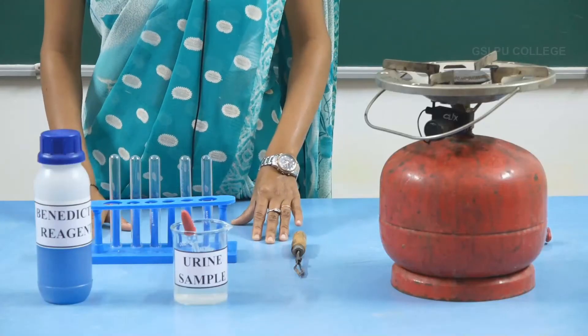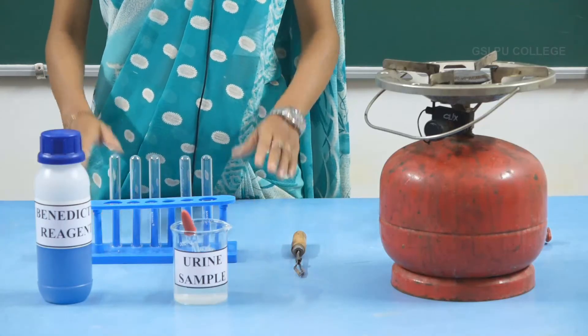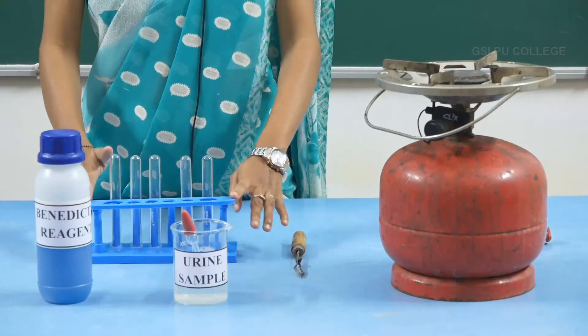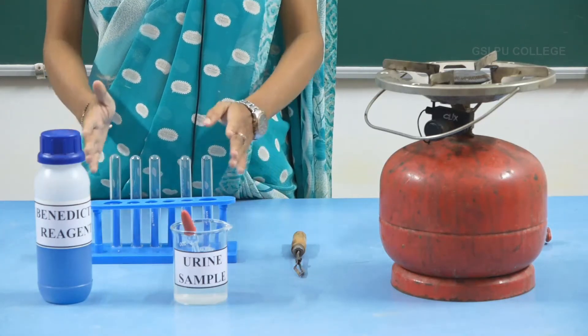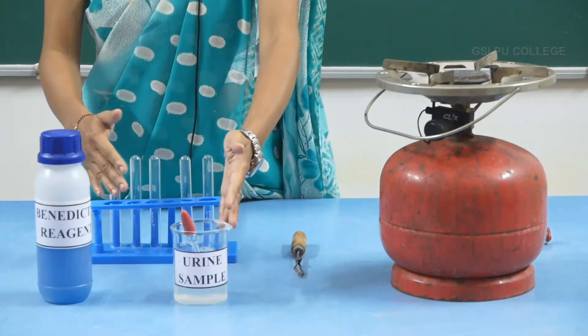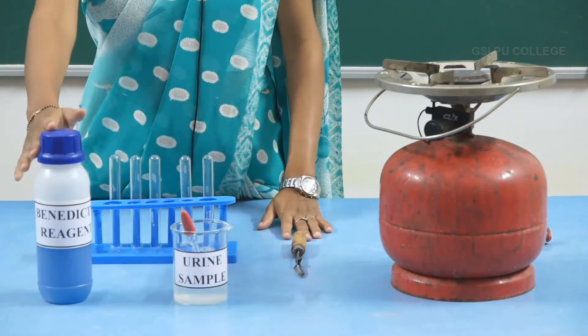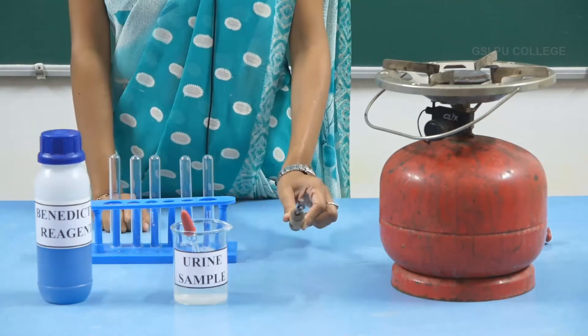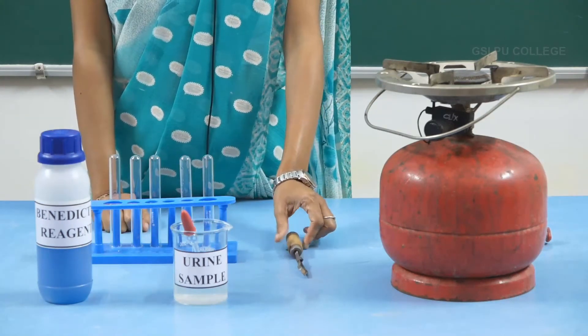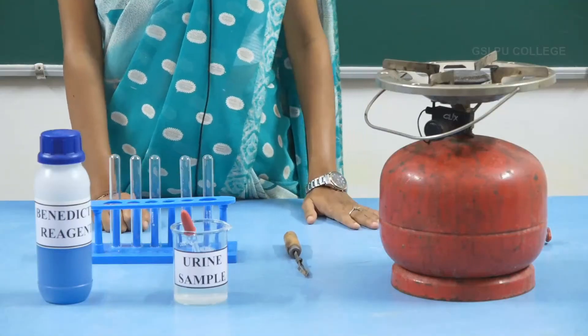For this experiment, the materials required will be a test tube stand, a few test tubes, a urine sample, Benedict's reagent, a test tube holder, and a stove for the heating process.